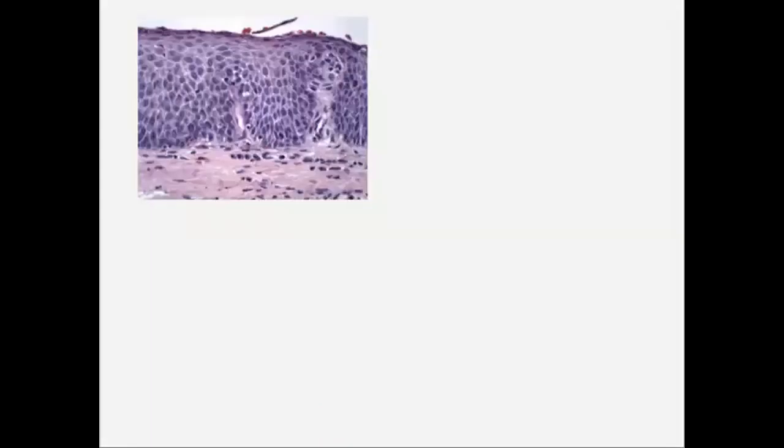The cell arrangement is also different in certain areas. So this purple colored part here is a stratified epithelium. There are several cell layers, and these circular dots represent the nuclei of each cell. The bottom part is the connective tissue. The cells here are wide apart. See these blue dots. And in between, we have the ground substance, with collagen and many others in pink color.